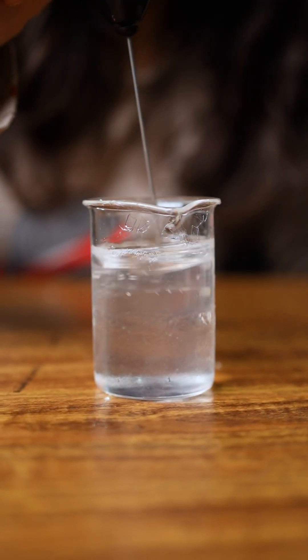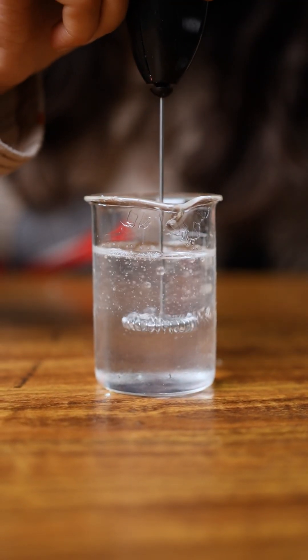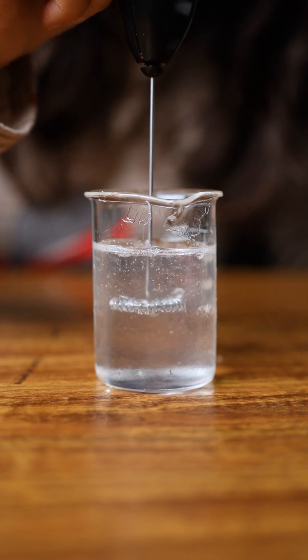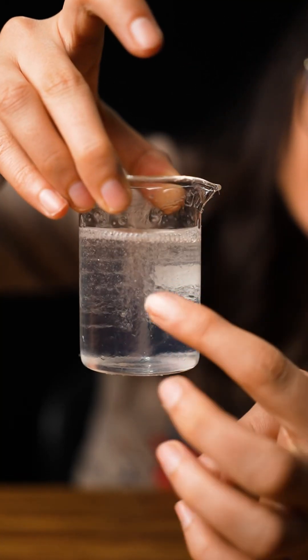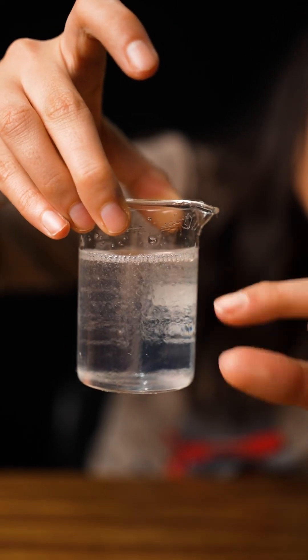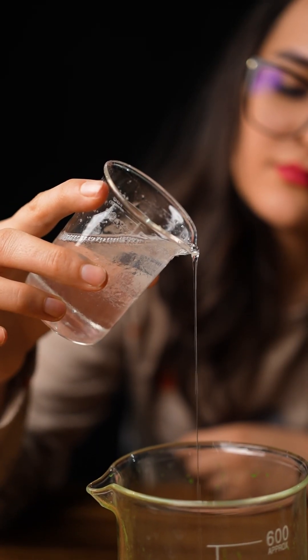I tried a lot but my mixer couldn't go any further, so I left it overnight. Here I compare the fresh and the old solution. As you see, the solution has two phases—one is viscous and the other one is much more viscous.